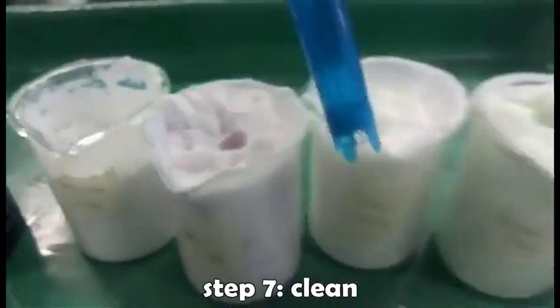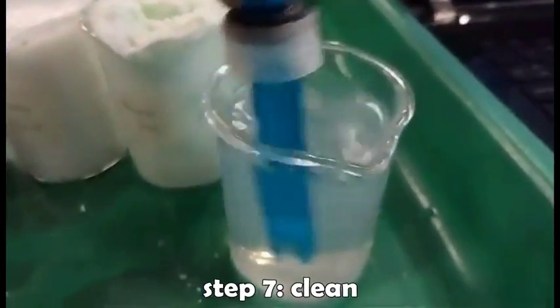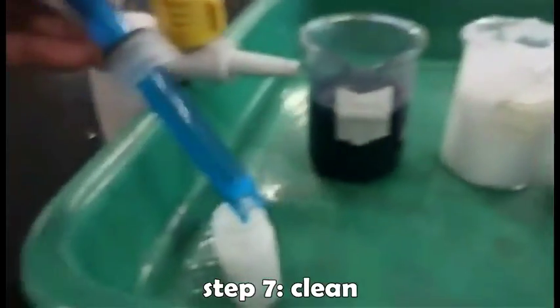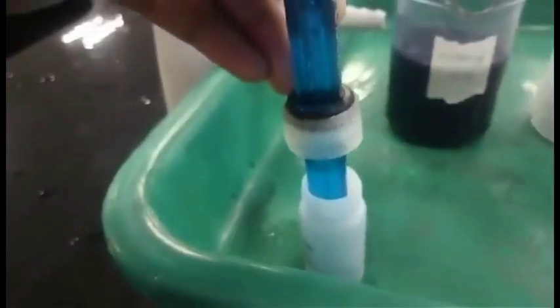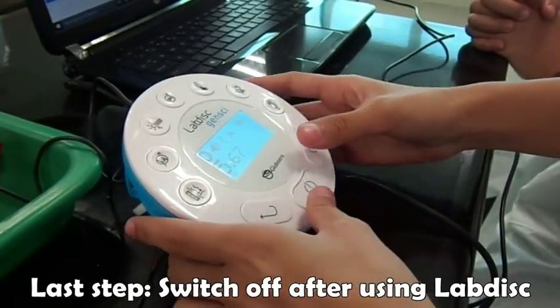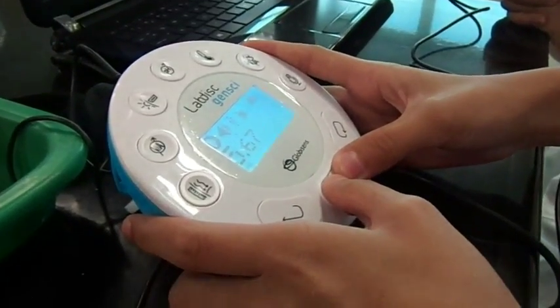Clean the electrode first before putting it in another beaker. After measuring, turn off the lab disc.